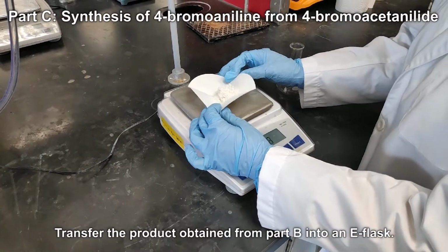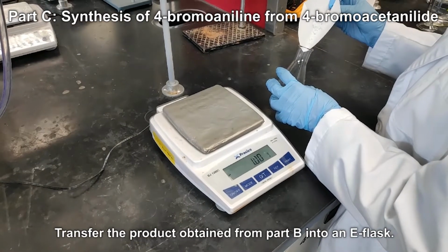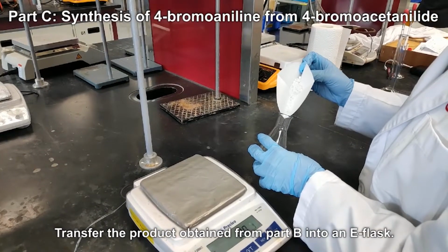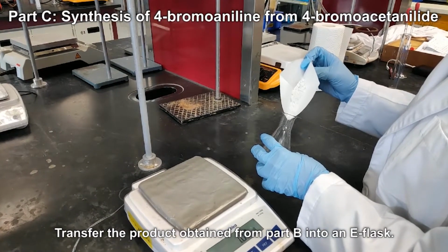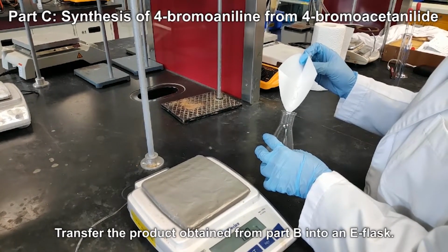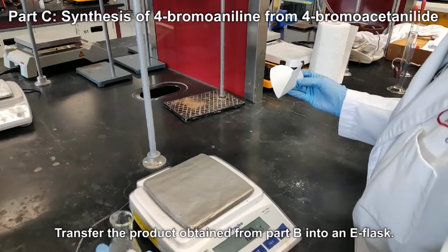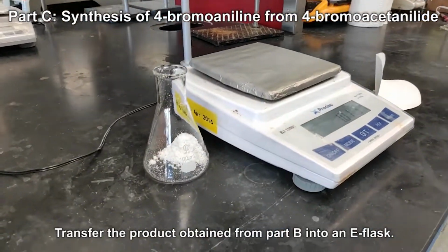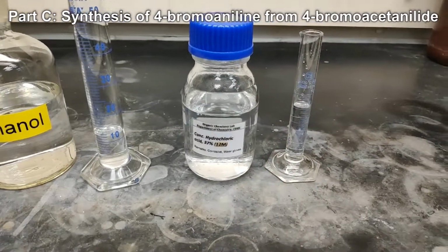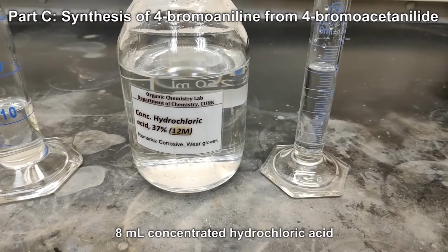Part C. Synthesis of 4-bromoaniline from 4-bromoacetanilide. Transfer the product obtained from Part B into an E-flask. 12 ml of 95% ethanol, 8 ml concentrated hydrochloric acid.